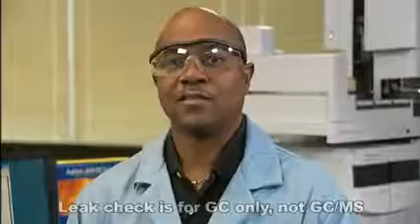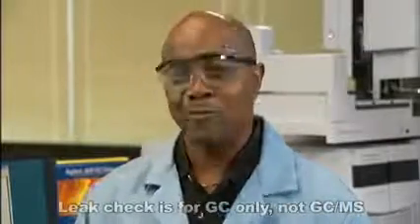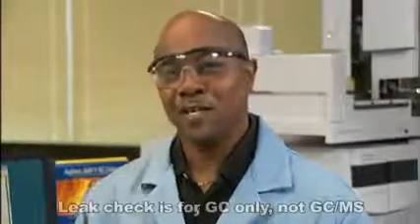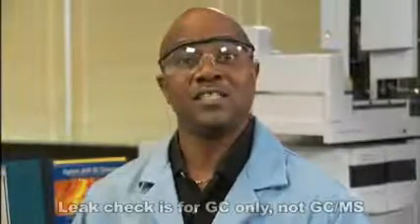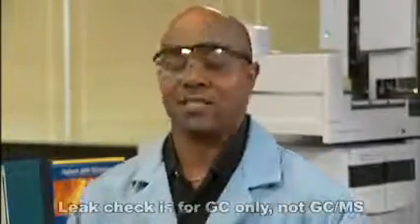Oh, one more thing. What we did was the manual way to run the test. If you're lucky enough to be using LabAdvisor, you could select the appropriate GC and run the prep run leak check. If you see a problem, you'll want to replace the liner. Now, of course, there could be other reasons for retention shifts.